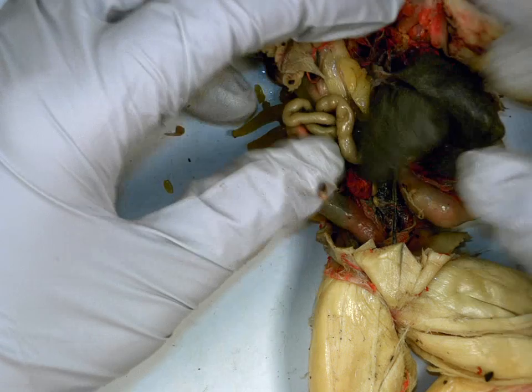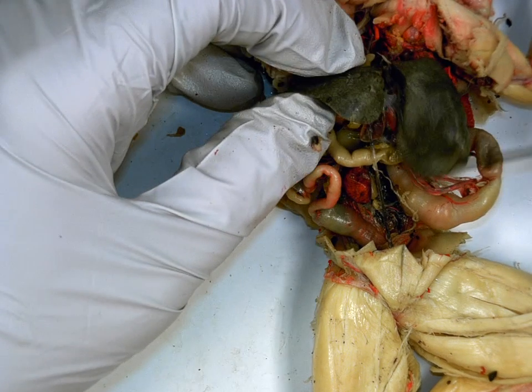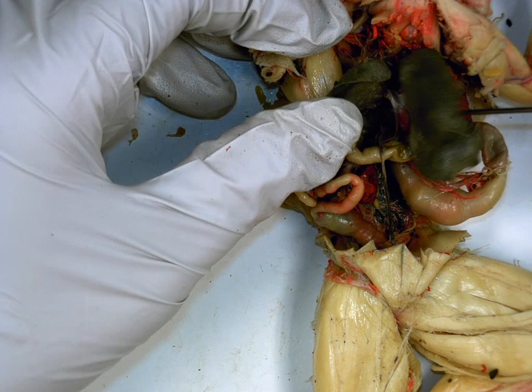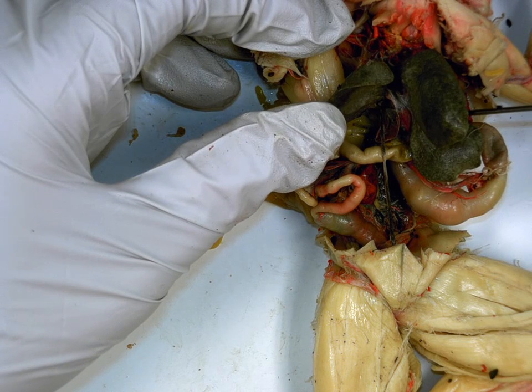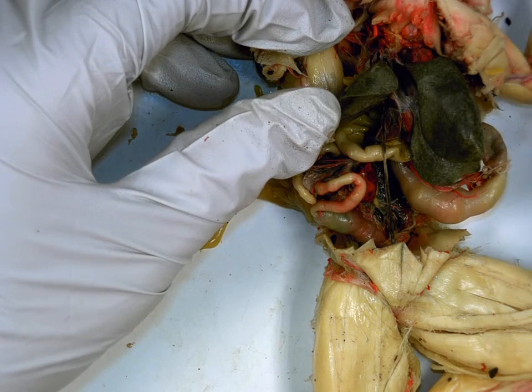Now let's go back up. What are these three dark things here? Liver. Liver has how many functions? One would be produce bile. Another one? Store nutrients. Another one? Remove metabolic waste. So just 3.